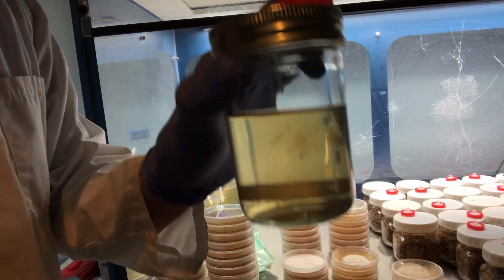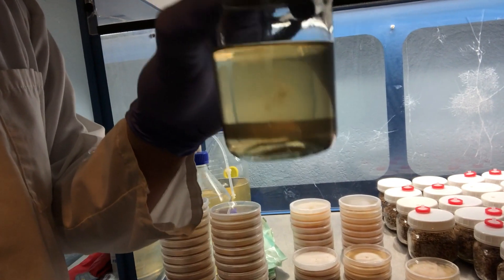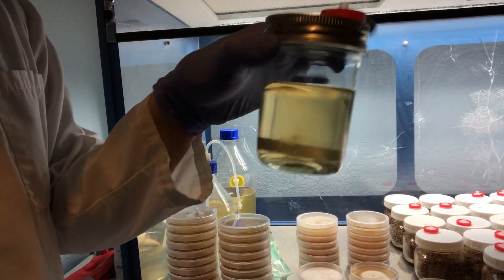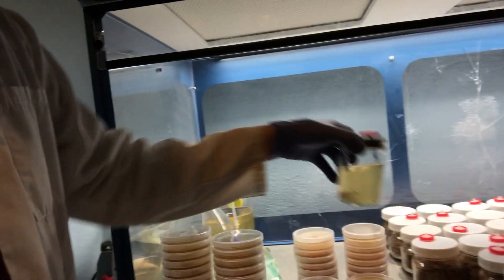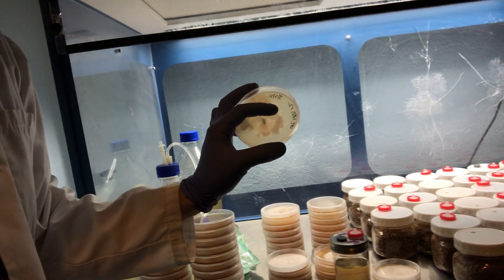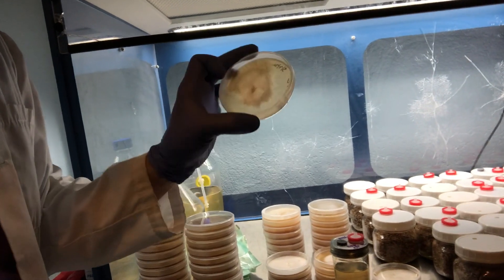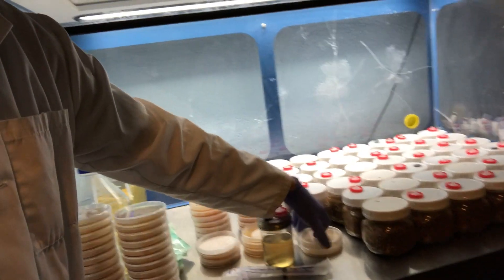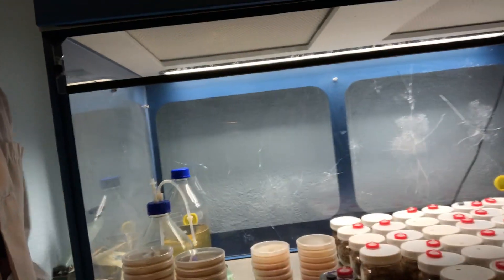You can see the mycelium right there from the spore solution — these are spores that germinated in the liquid culture. You can see how clear that is, so I'm pretty confident there are no contaminants. This is just a trial so I won't QC these ones, but I'm going to be inoculating these against plated out crosses of black pearl kings as well. This one is actually a black pearl king crossed with a Pleurotus djamor. I'm interested to see how that comes out. I've also got another subset of just the A and B cross that I'm going to be spawning.